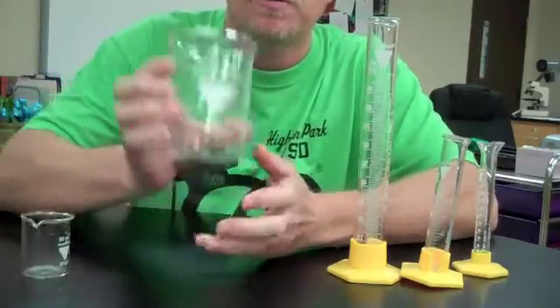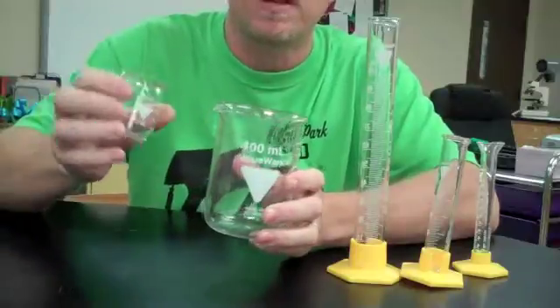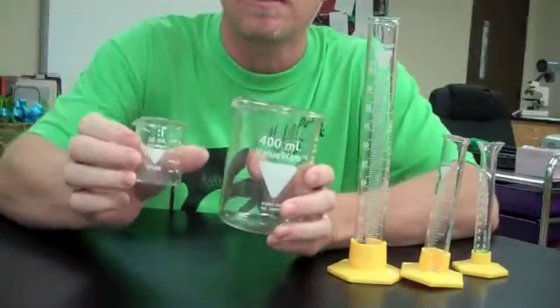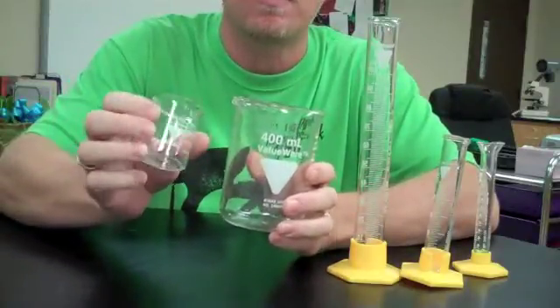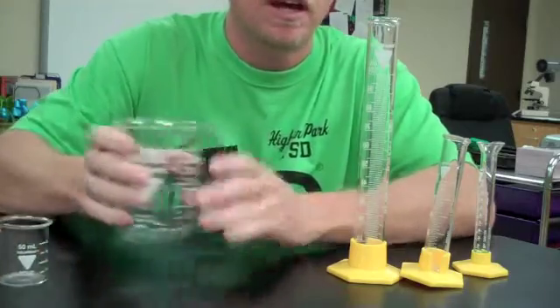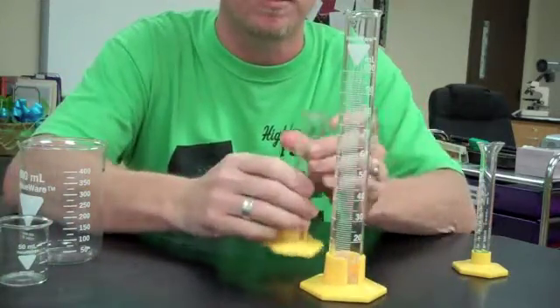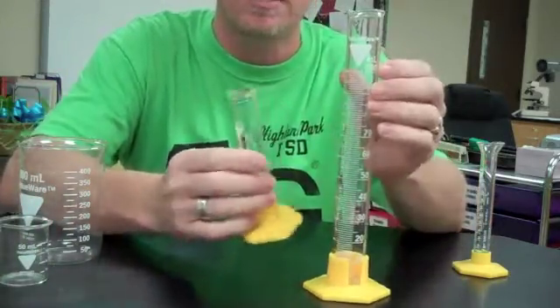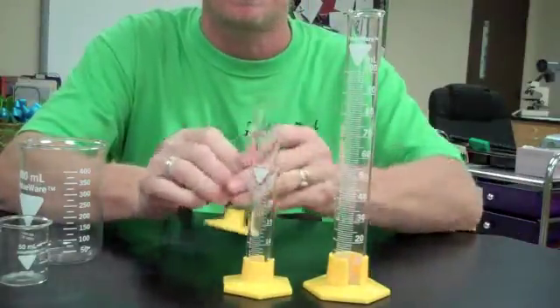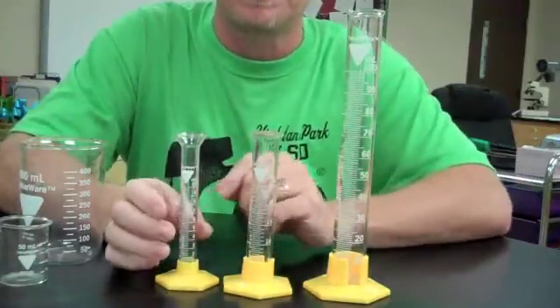In chemistry we use beakers, and beakers come in different sizes - they come much bigger than this, and also about this size. This is a 50-milliliter beaker. We also have graduated cylinders that come in different sizes as well. This is a 100-milliliter, this is a 25, and this is a 10-milliliter graduated cylinder.